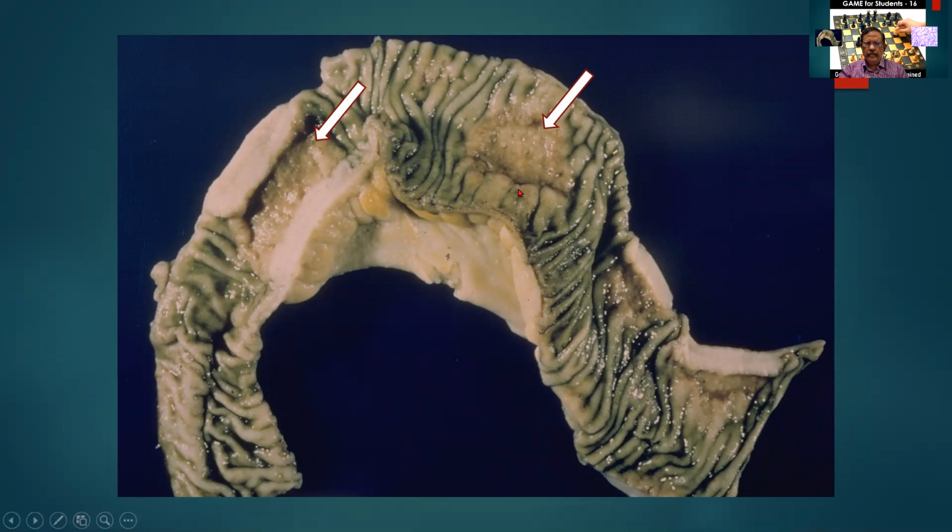Again, a part specimen of the intestine measuring so many centimeters long. The external surface is pinkish brown and it may show a few nodules. Kindly look for it. If there are no nodules, just leave it as unremarkable. There are two ulcerative lesions which are marked by the white arrows and they measure so many centimeters by so many centimeters in dimensions. They are separated by multiple mucosal folds of normal intestine.